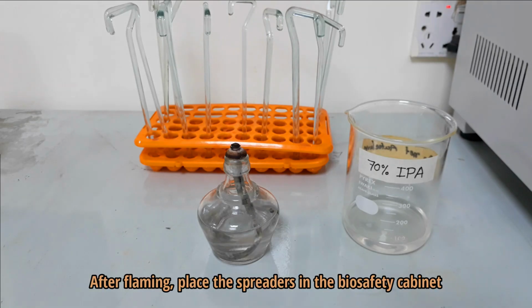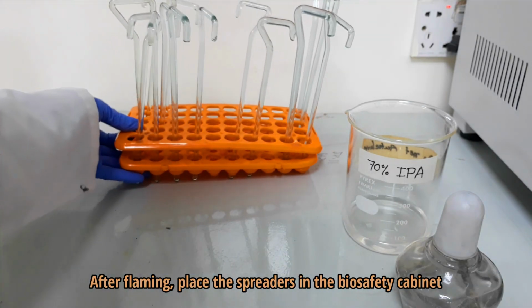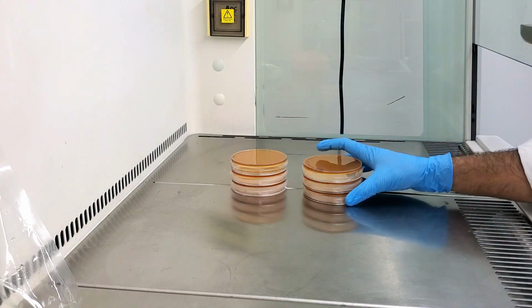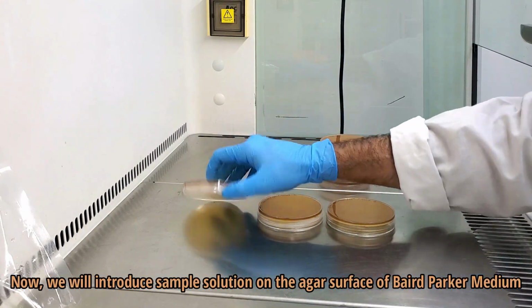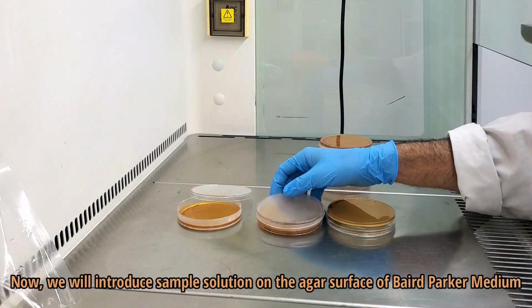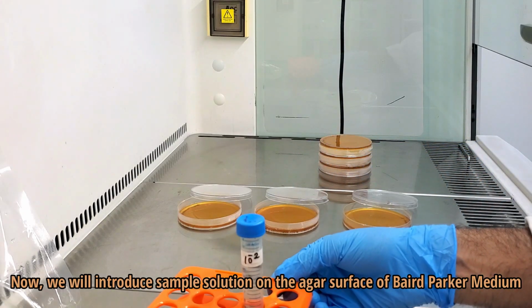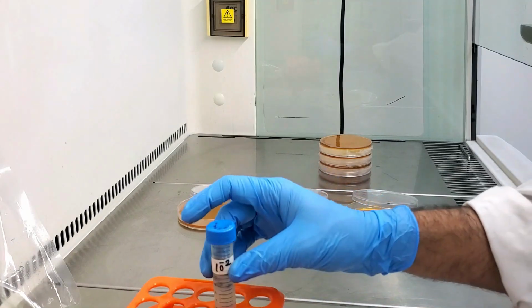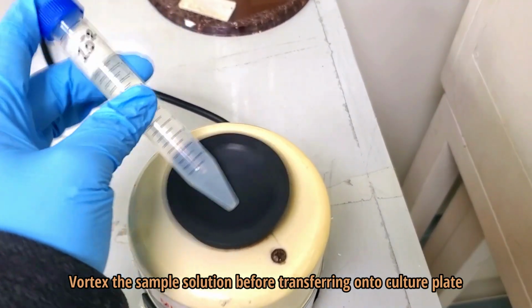After flaming, place the spreader in the biosafety cabinet and allow it to cool for 5 minutes. Now, we will introduce sample solution on the agar surface of Baird-Parker medium. Vortex the sample solution before transferring onto culture plate.